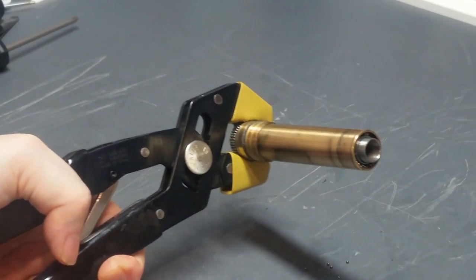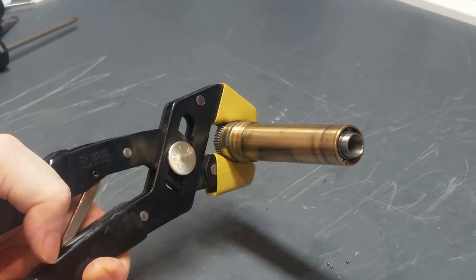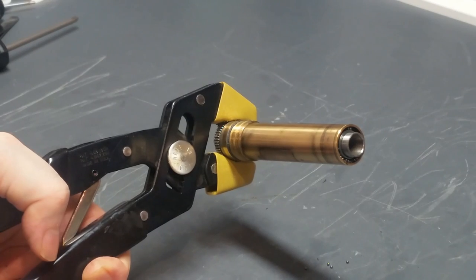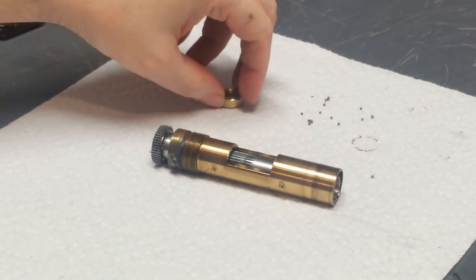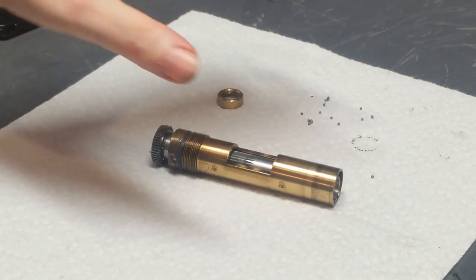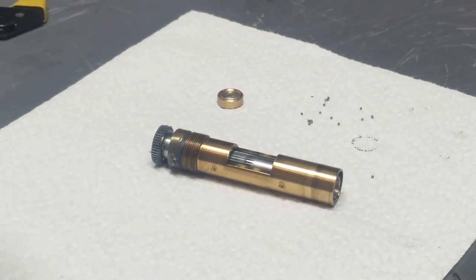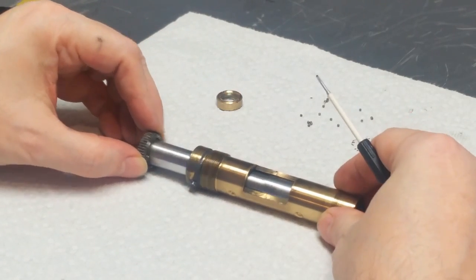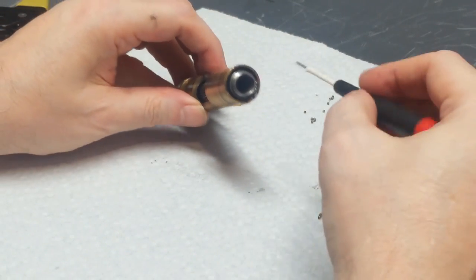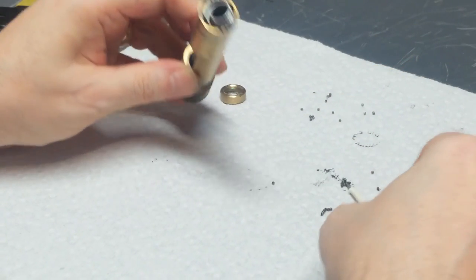Okay, let me put a piece of paper towel or something under this so that I can catch these easier and so that maybe you can see it a little better. Okay, now I've put a paper towel under this. It's not a big deal for me when I'm working on these if one or two of these balls falls away and gets lost forever because, hell, I have 1,000 of them in the drawer over there. That's not a big deal for me. You can buy these on Amazon. These are 1/16 inch steel bearings. G25 quality is sufficient for these.